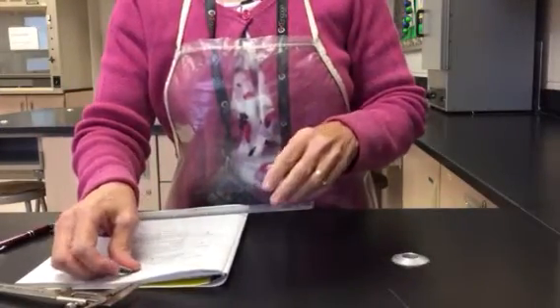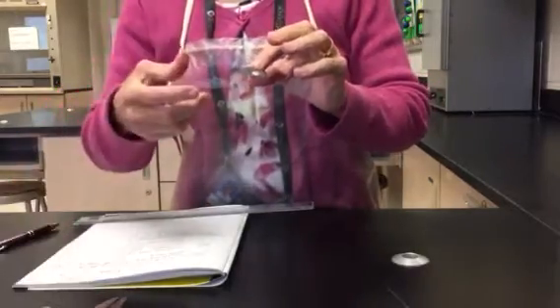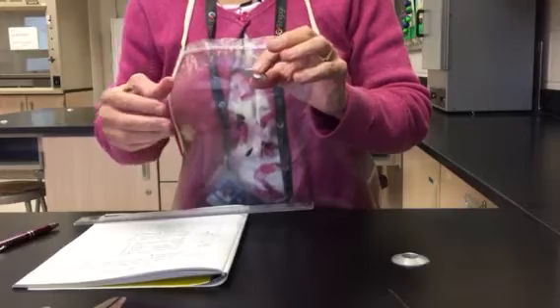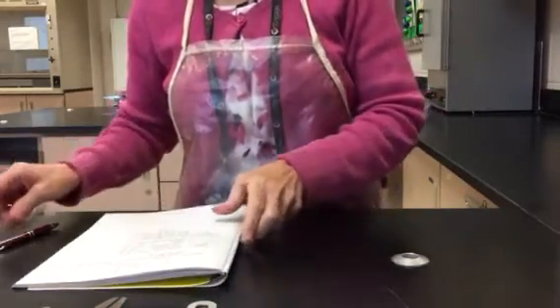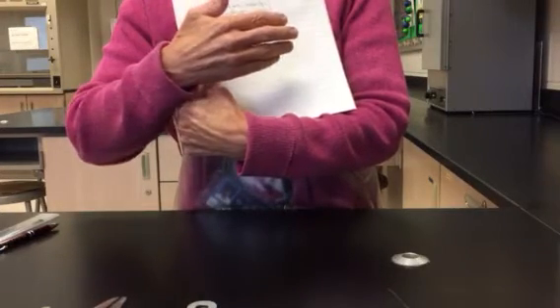Hi folks, in today's lab we're going to determine the thickness of the zinc coating on a washer. We're going to do that by removing the zinc that's on the washer by reacting it with hydrochloric acid. Before we begin, I'm going to make sure that my lab notebook is ready, and I have in my lab notebook the title, the objective, the date, and I have a data chart already prepared.